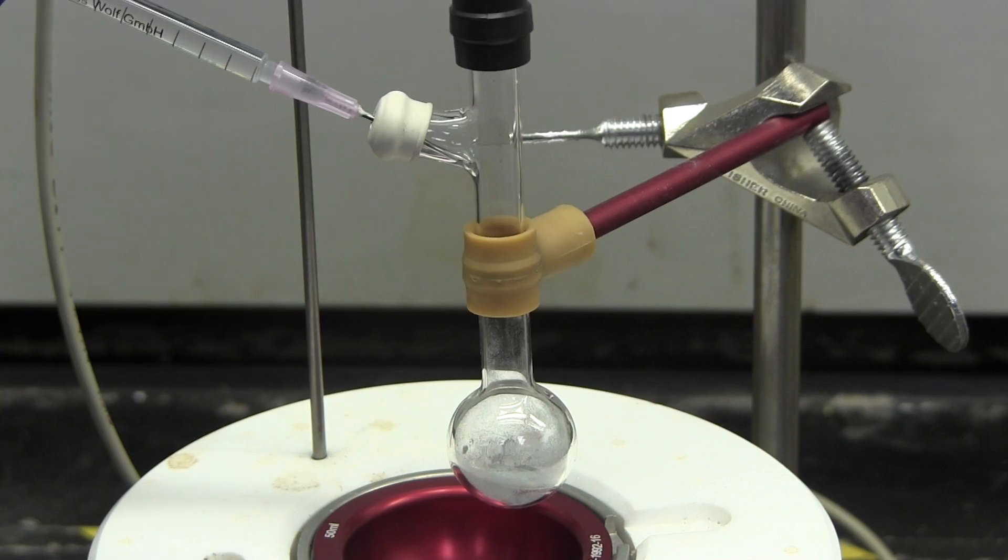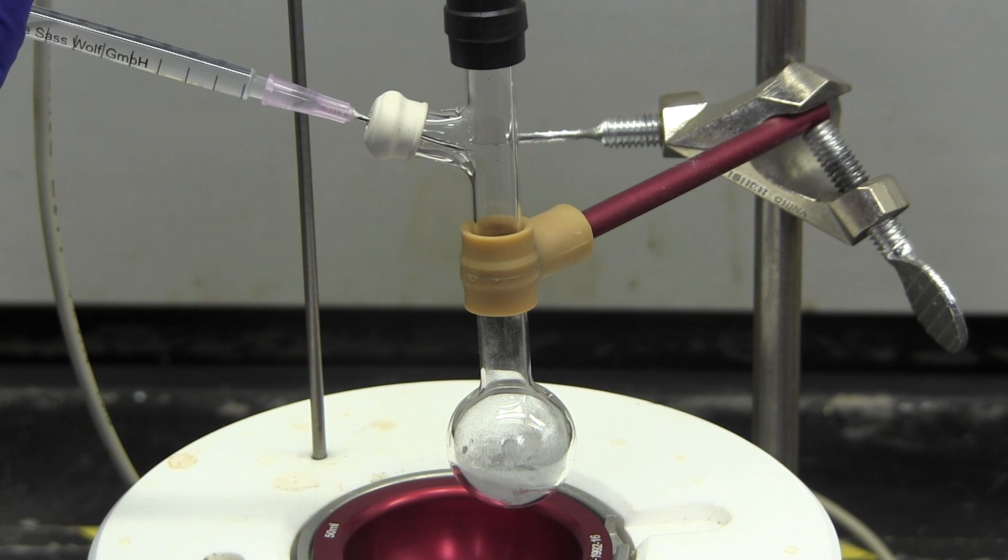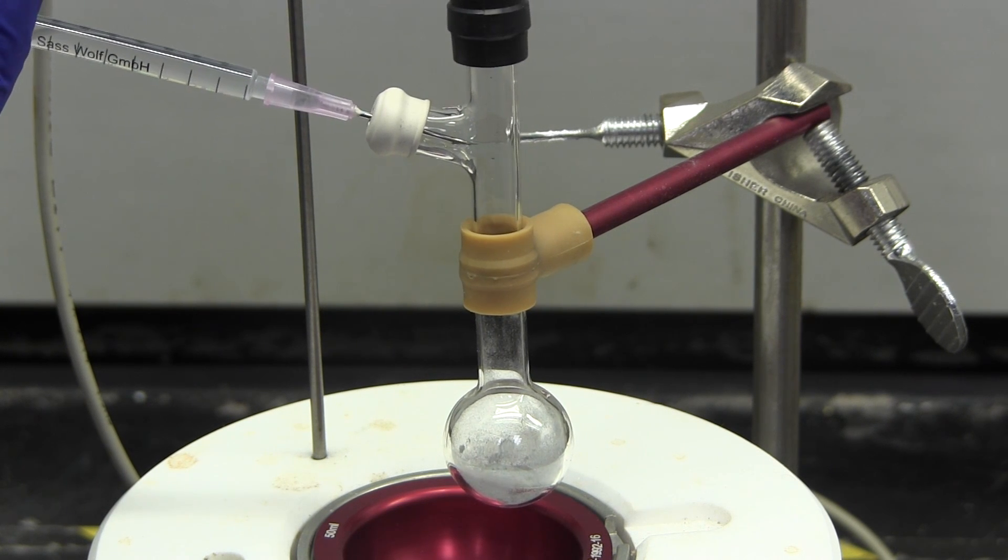Any reactant solution or solvent that you add to this reaction must be done using a syringe and injected through the septum.